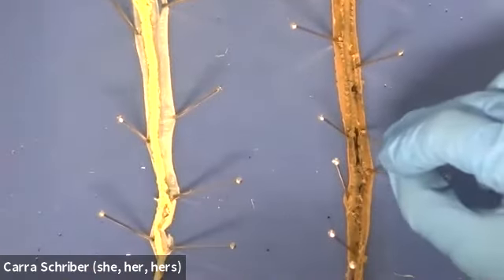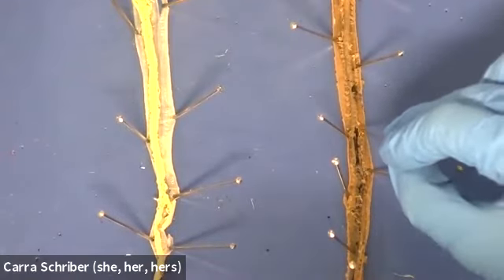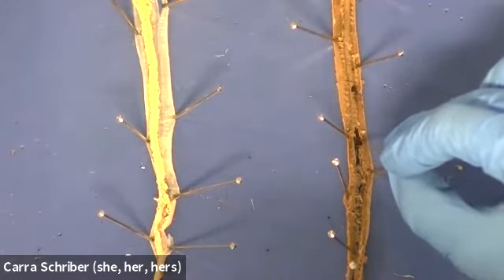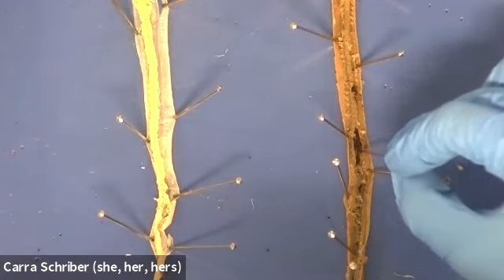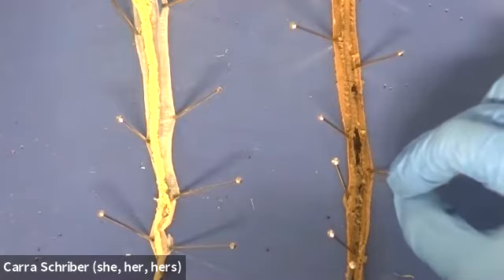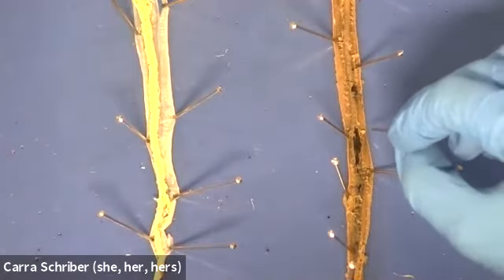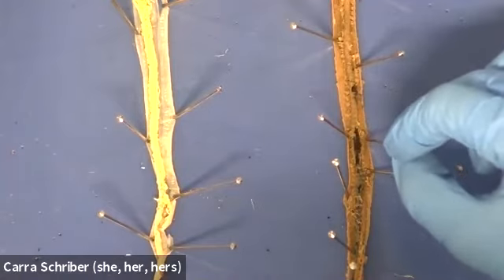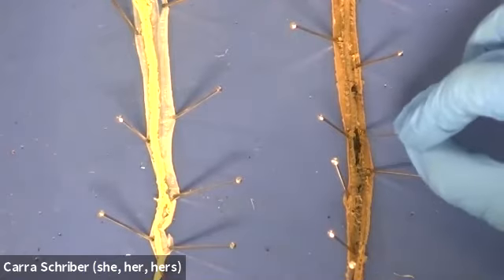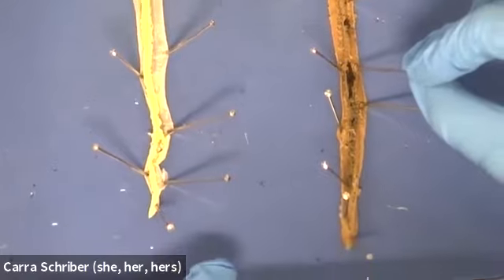This is also the intestine, but I dug a little bit too deep when I was doing my dissection, and I cut through the intestine here. And so what you're actually seeing here is the intestine has been cut, and that brown or dark stuff is waste product, right? So it's escaping through this cut open intestine. And I mean, it's kind of gross, but also, earthworms just eat dirt. So I'm pretty much just looking at digested dirt, and that doesn't freak me out too bad. But that's why that looks different. I just didn't want you to think that it was supposed to look that way.